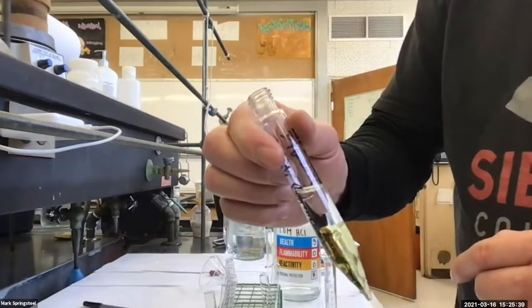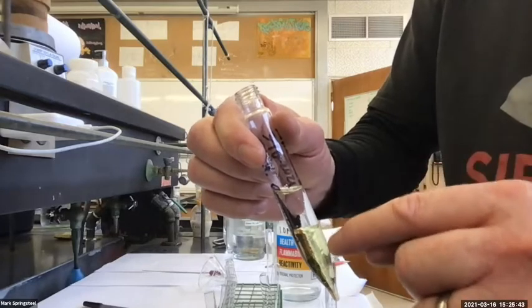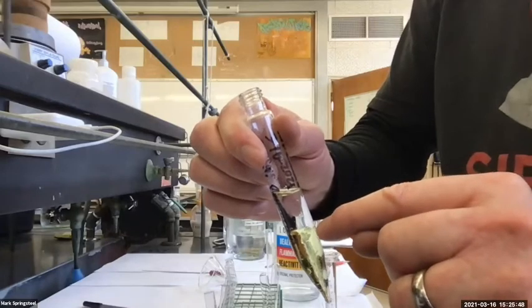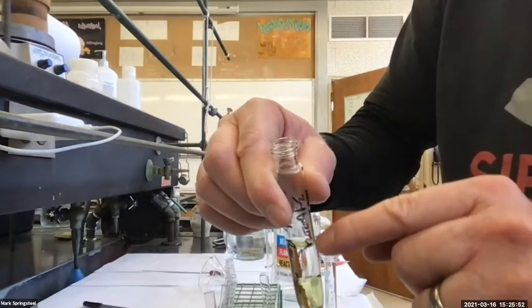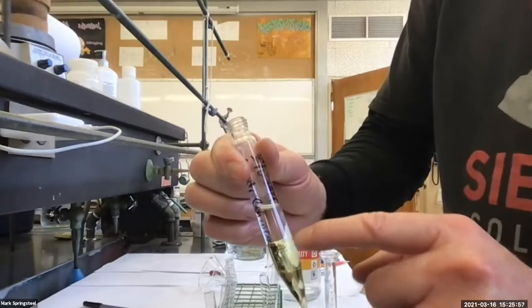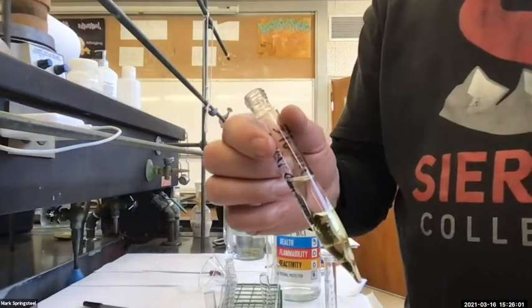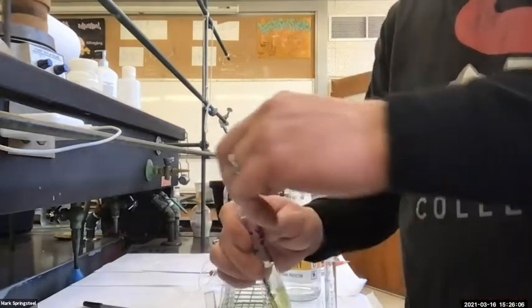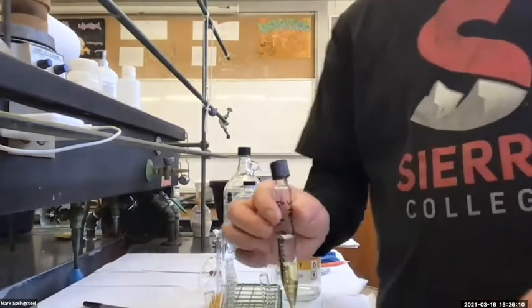So right now, there's only a reaction occurring between the 2 phases, the organic and the aqueous. It's only interacting right at the surface. There's actually a little organic sitting on top of the water, the water's surface tension. So there's not really great reaction conditions now. What can I do to help this reaction take place, help the amine get protonated? Shake it up. Yep.